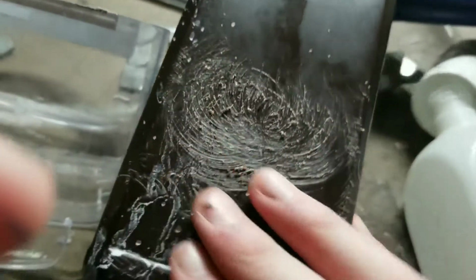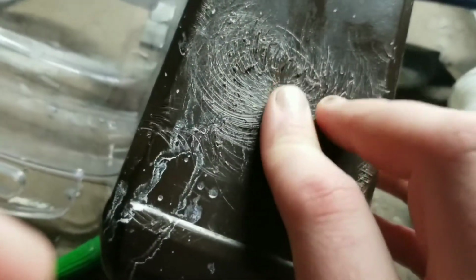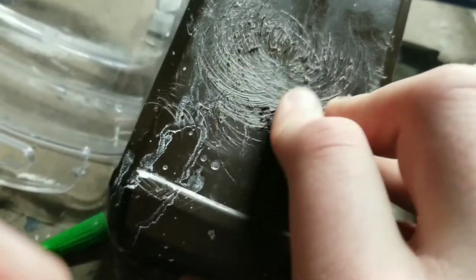While the super glue's drying, I tried to drill a hole in this, but I didn't start with a guide hole, and this is how it ended up. I'll have to flip this over and try again at just the right place.